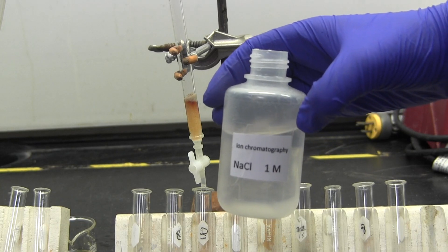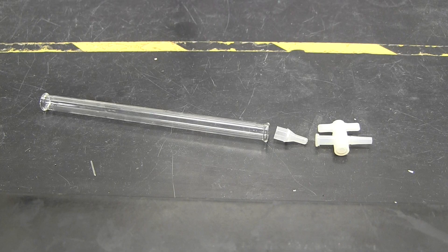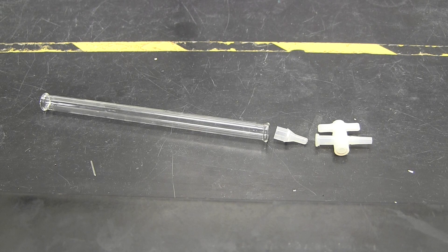To separate them, you will be using sodium chloride solutions that have varying concentrations, from 0 to 5 molar.